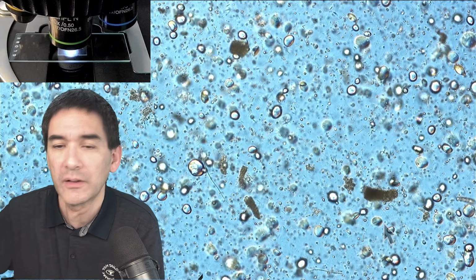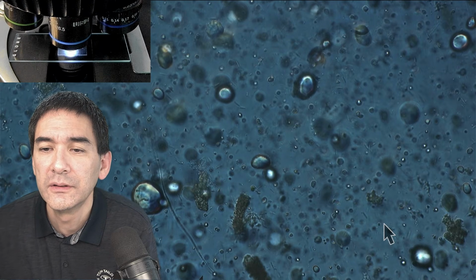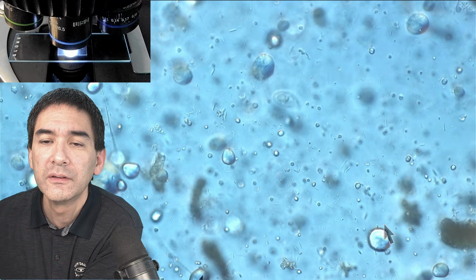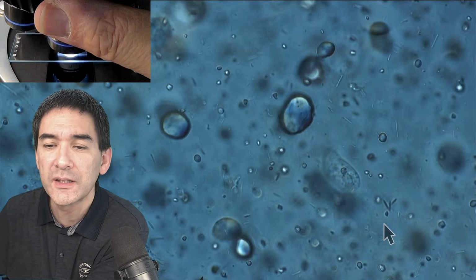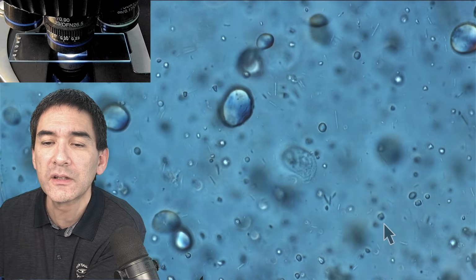I'm going to zoom in. Otherwise, we're just going to have a close look at this one over here. Here we go. It's too dark. Here we go, right here in the center. Focus a little bit. Yeah. So let's go up with the magnification, 60 times. Here we go. Now you can also see the bacteria slowly moving.